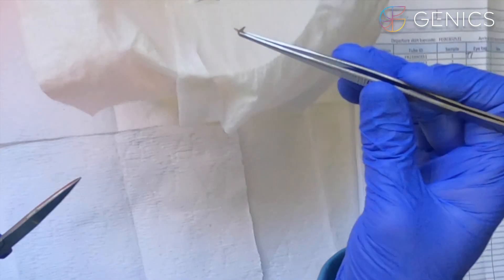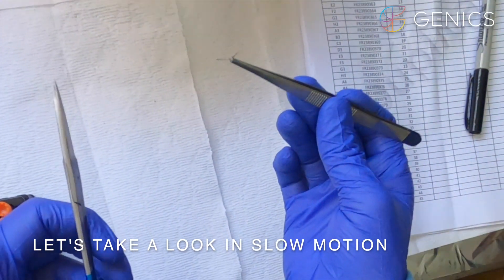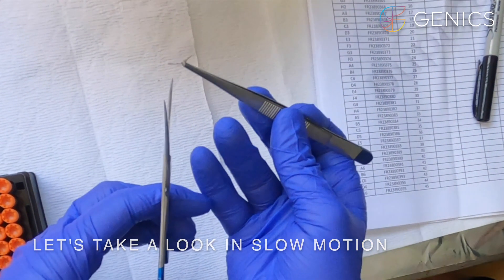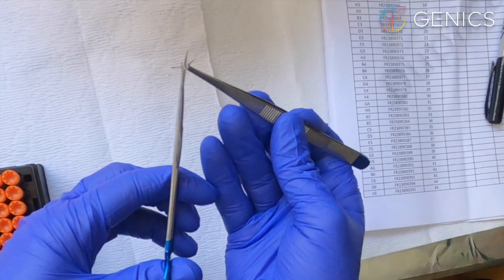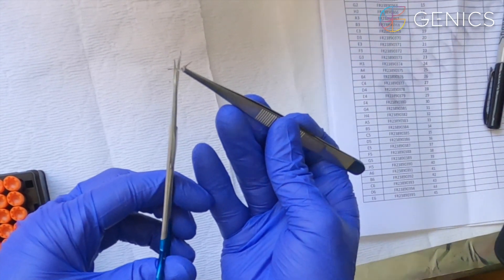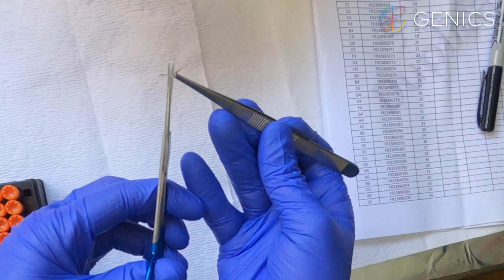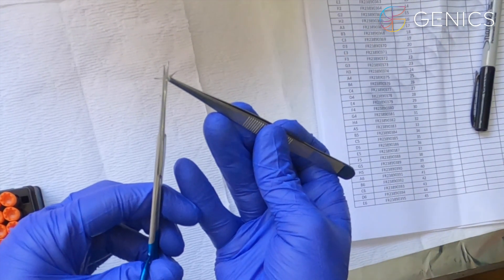Now let's take a slow motion video of how we dissect the head from our shrimp. We remove the tail muscle, in this case using a pair of scissors.